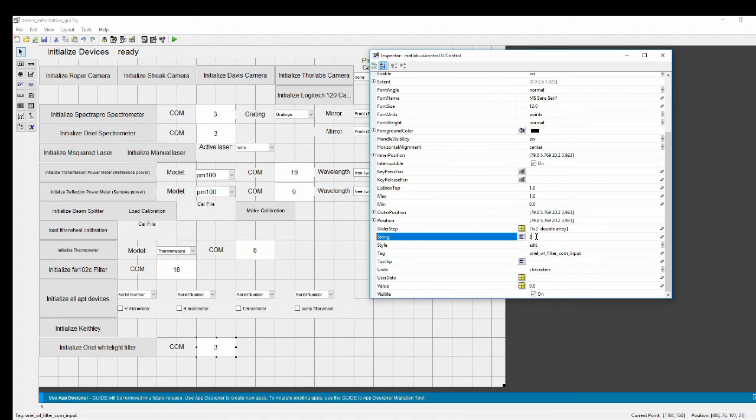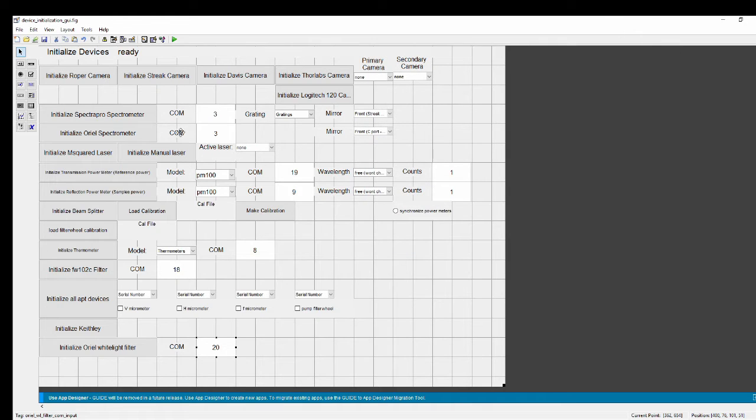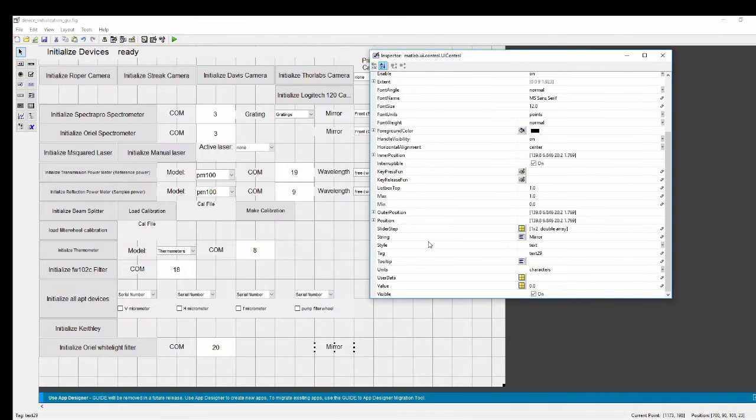And the default number, I just chose one, is 20. Since that's the COM port that my Oriel spectrometer is currently on my computer. Okay, that looks good. And now we go ahead and copy this mirror. And again, this tag really doesn't matter, but we'll keep our naming convention.